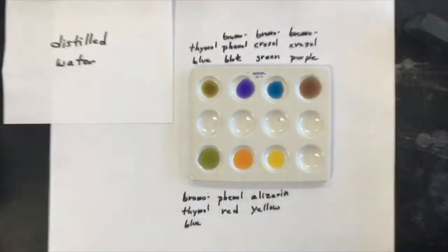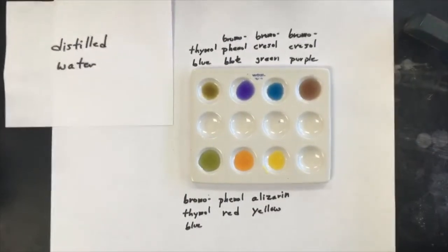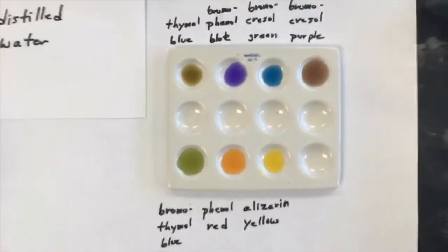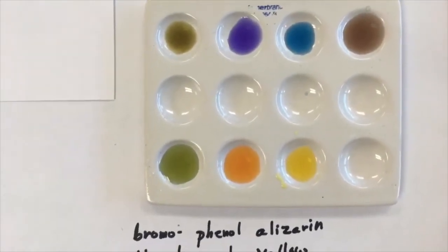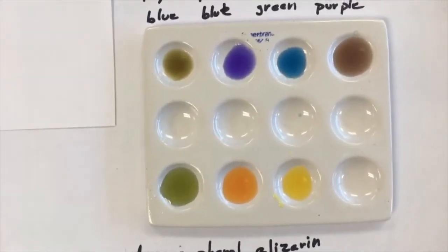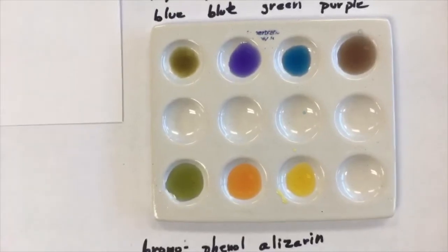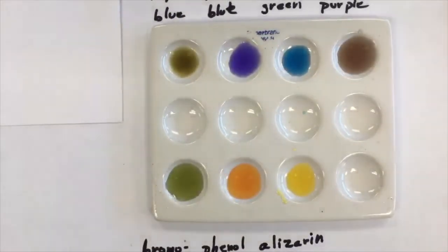Alright, and then let me sort of zoom in for you. Hopefully you'll get a better look at these colors. So I'm afraid you'll have to remember which indicators and which one by looking just a little bit earlier in the video. But there are the colors for distilled water.